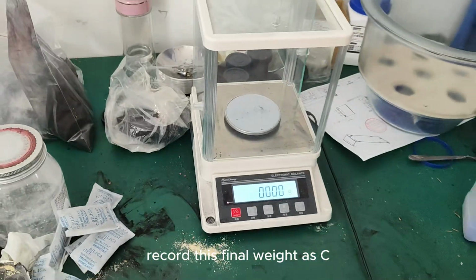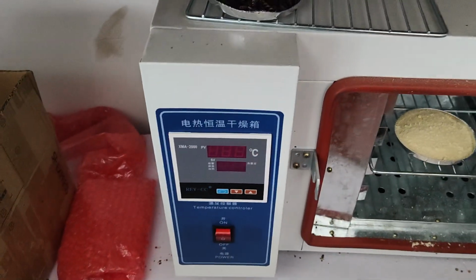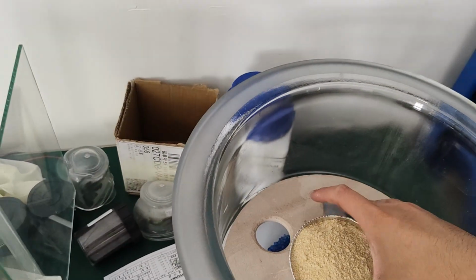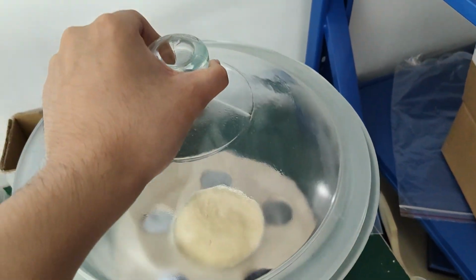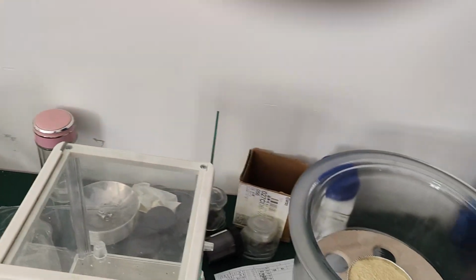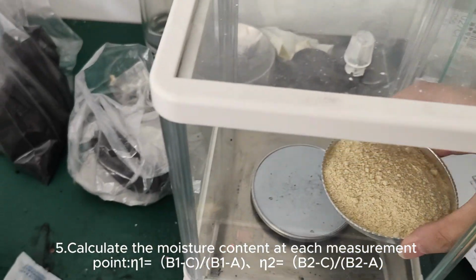Record this final weight as C. Calculate the moisture content at each measurement point.